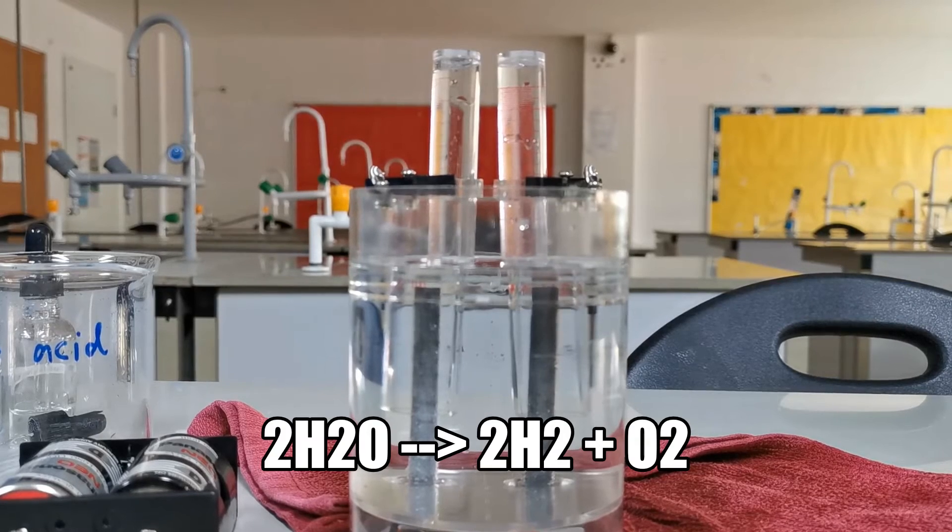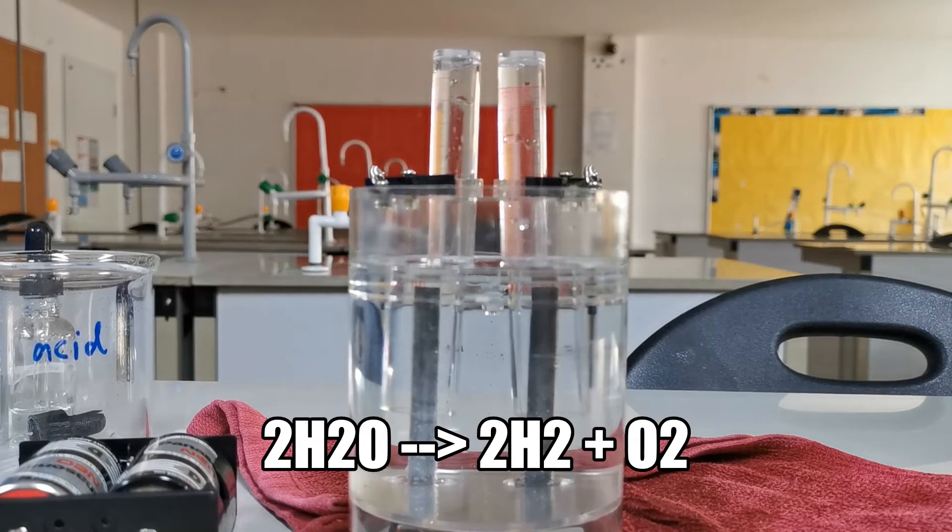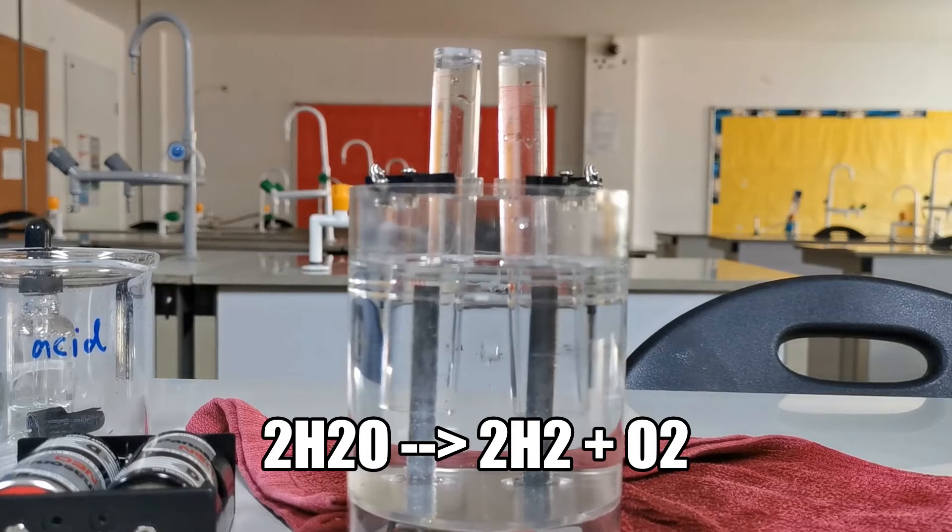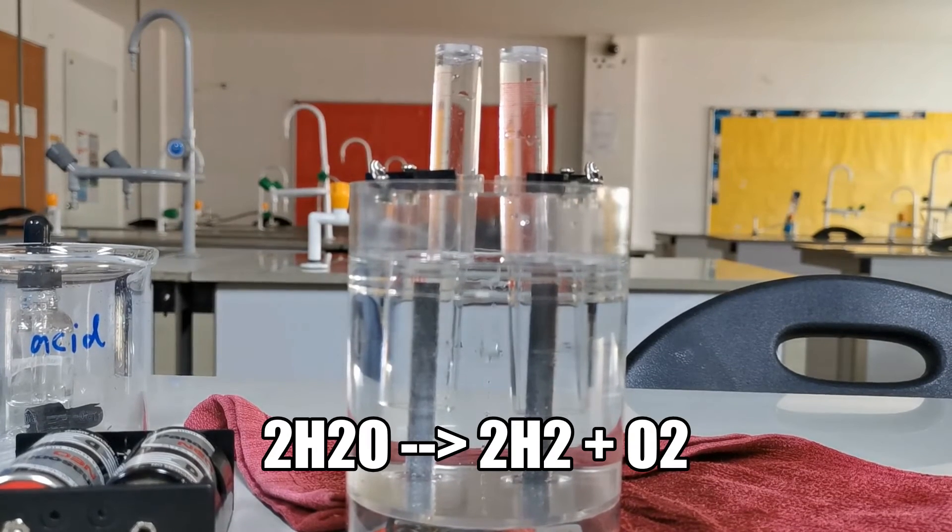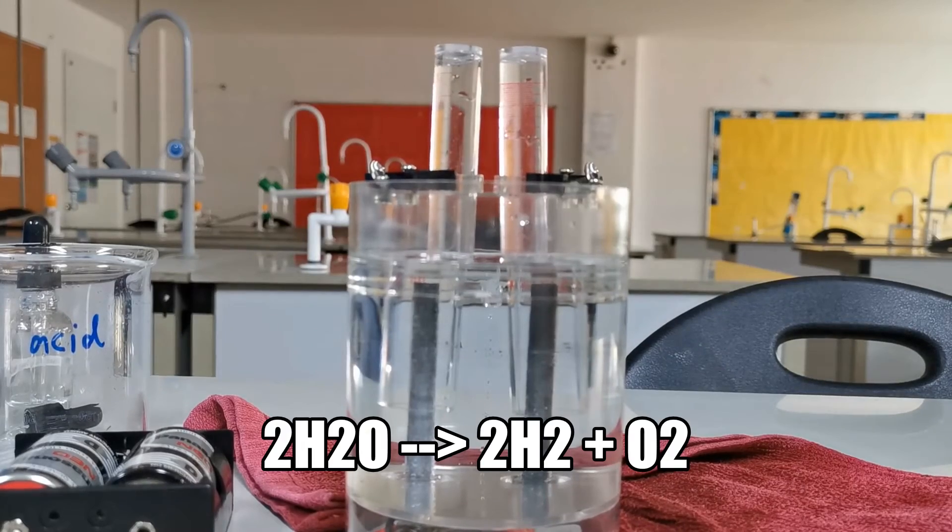Using the balanced reaction equation, you can see that there are twice as much hydrogen as compared to oxygen.